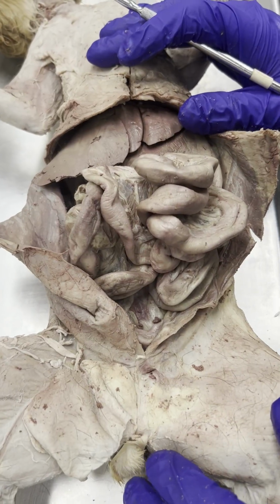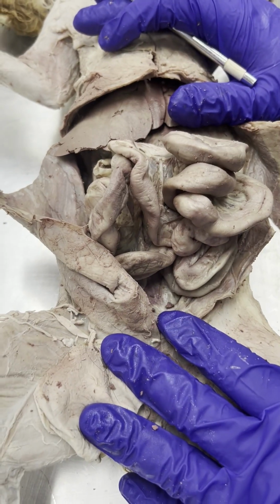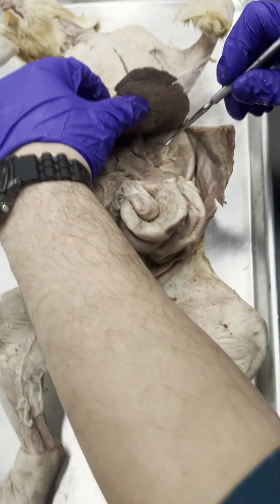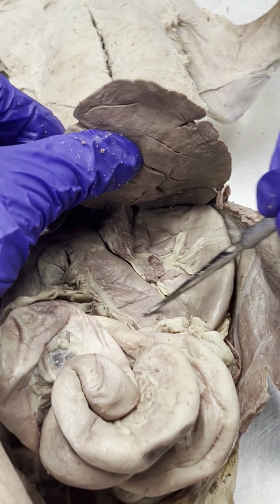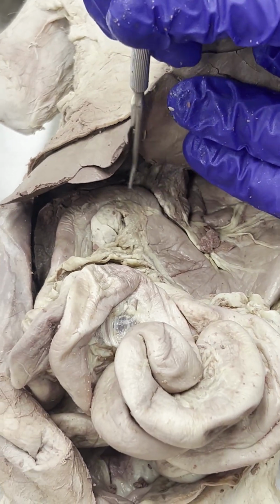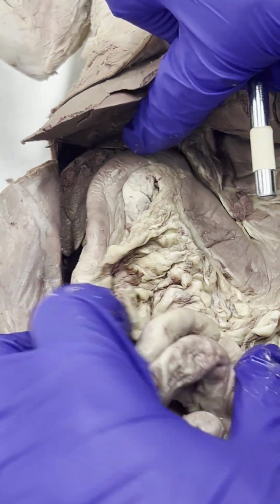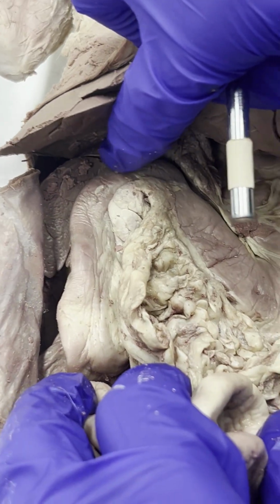Hello, vertebrate anatomists. We are going to wrap up the last video of the digestive system with the cat. So if you recall, we learned where the stomach was, which is all of this. Hopefully you know the different parts of the stomach, and hopefully you know that after the stomach lies the small intestine. So, stomach, and then here's our small intestine. The small intestine has 3 parts to it.